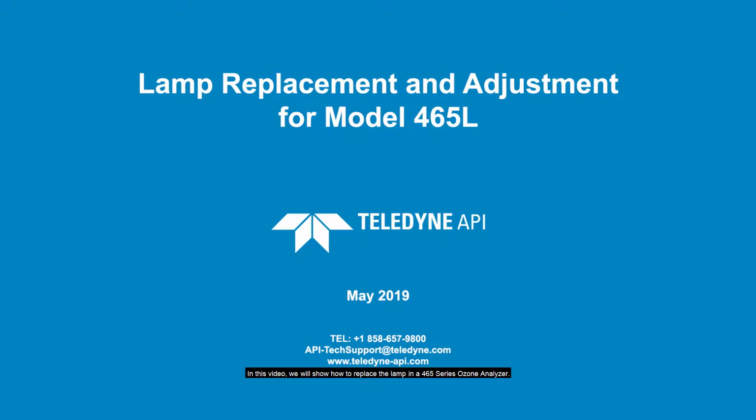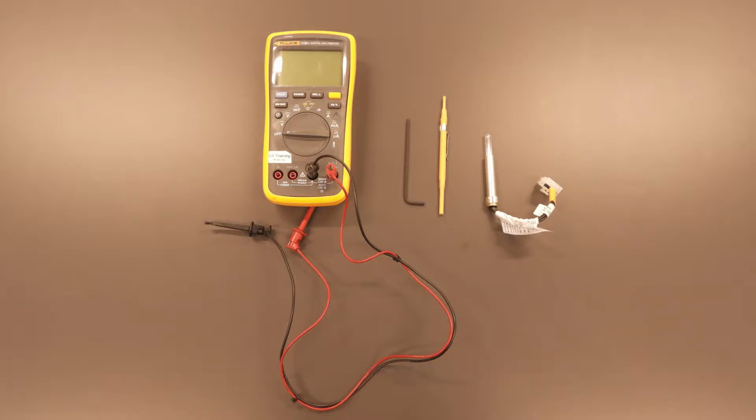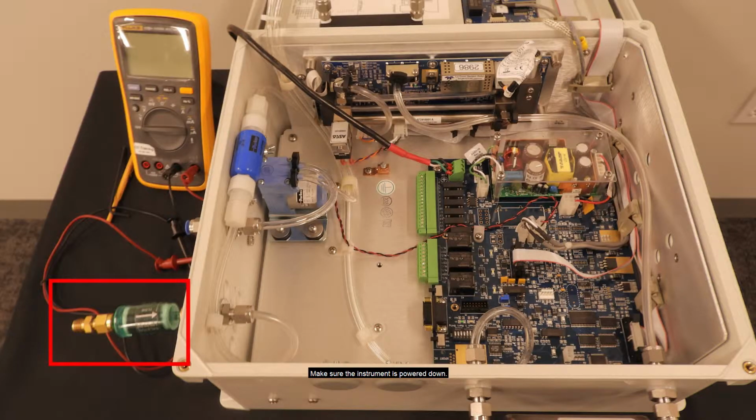In this video, we will show how to replace the lamp in a 465 series ozone analyzer. For this procedure, you will need a digital multimeter, 7/64 Allen wrench, pot trimmer or small screwdriver, and a replacement lamp. Make sure the instrument is powered down.